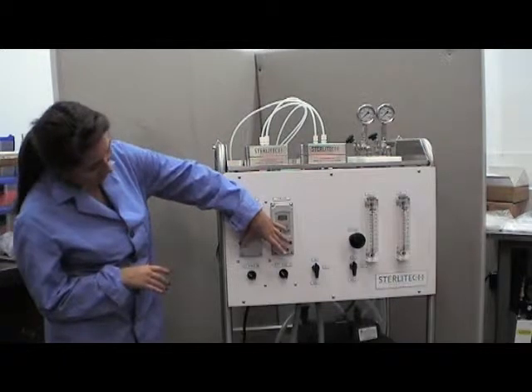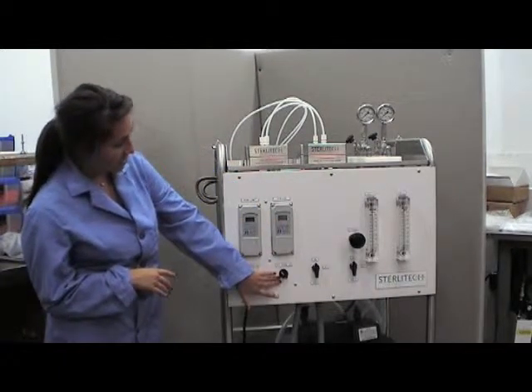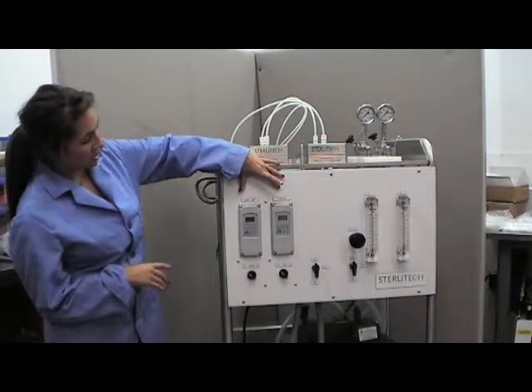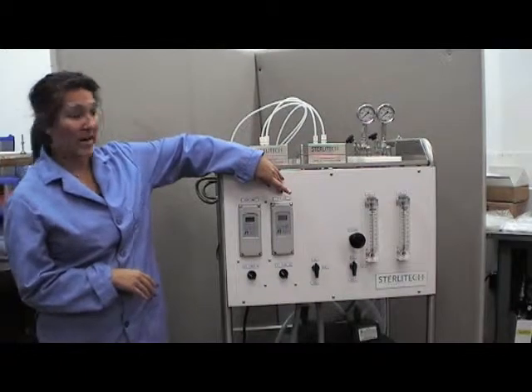Here you're going to have both of your power switches for turning the system on and turning the pump on. The chiller indicators show the high limit and the current temperature at which the system's operating.